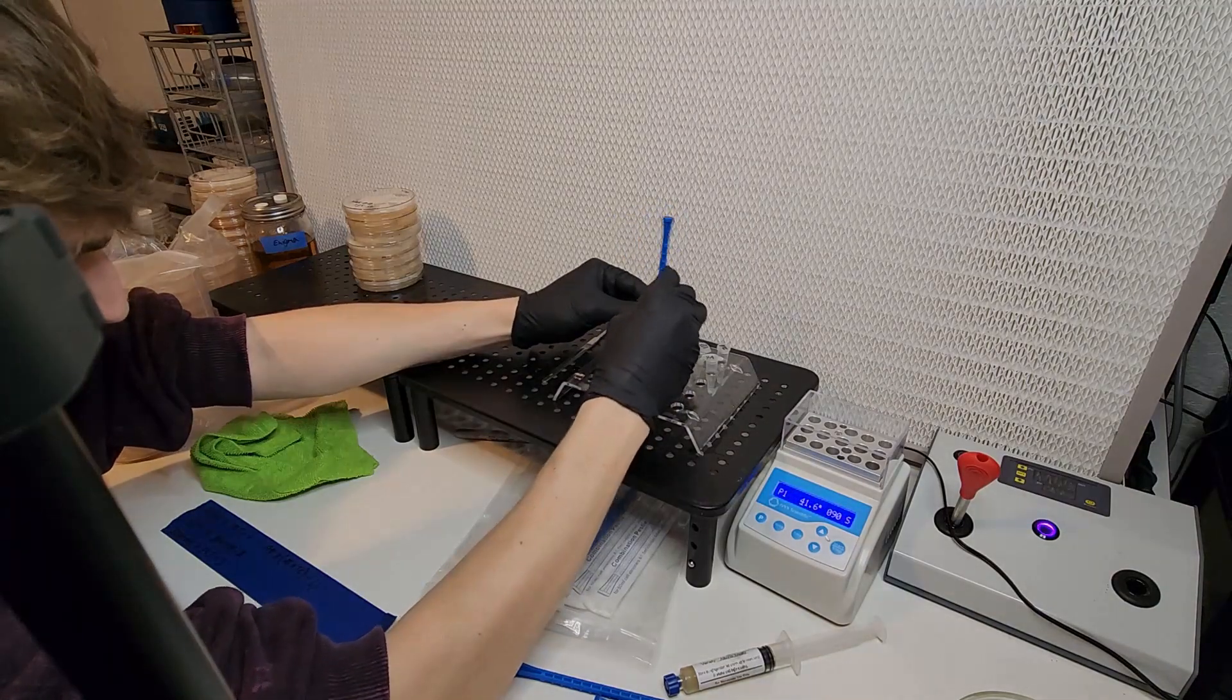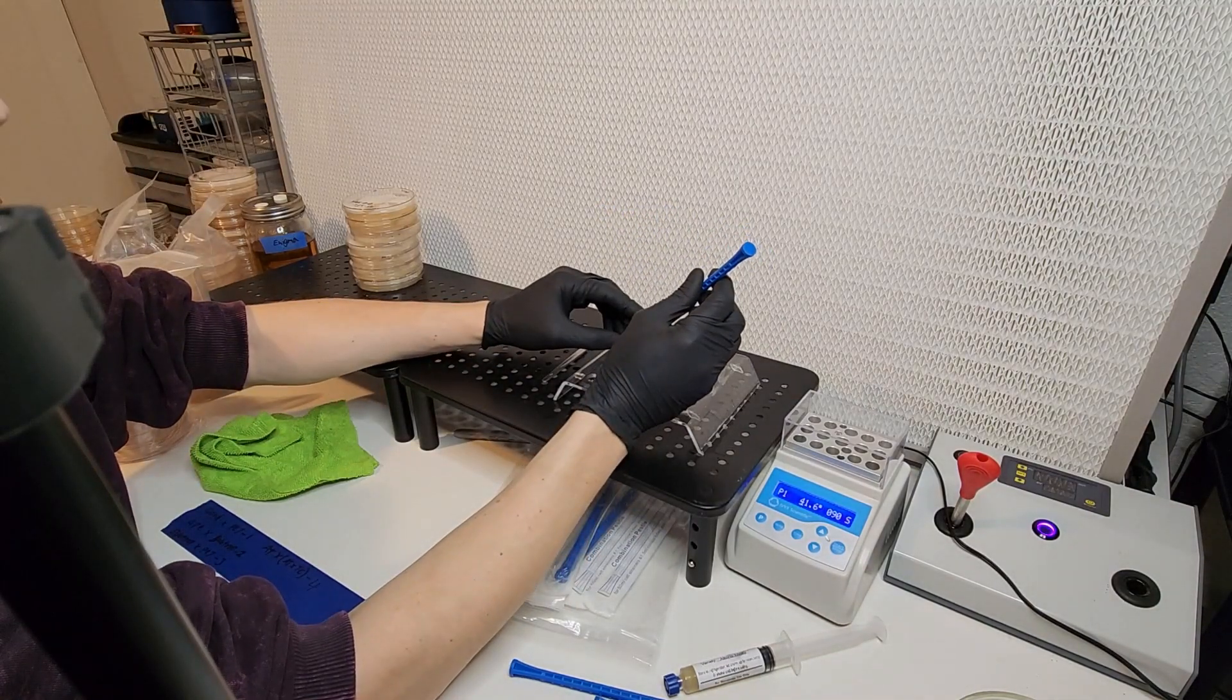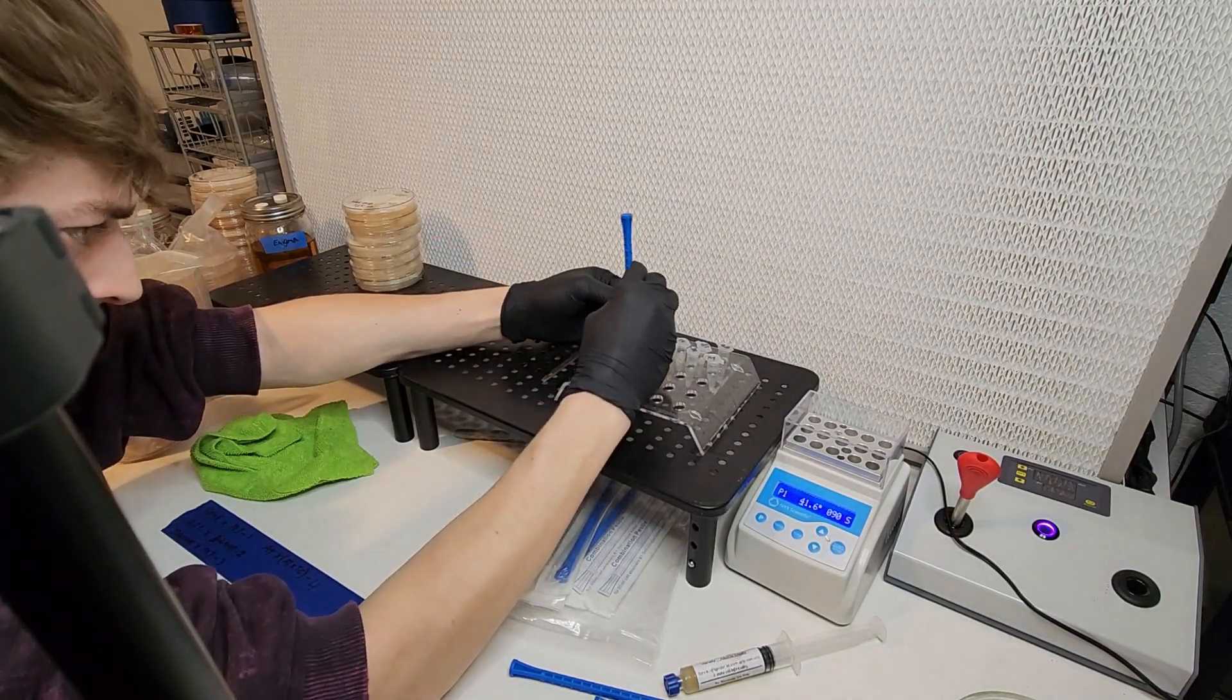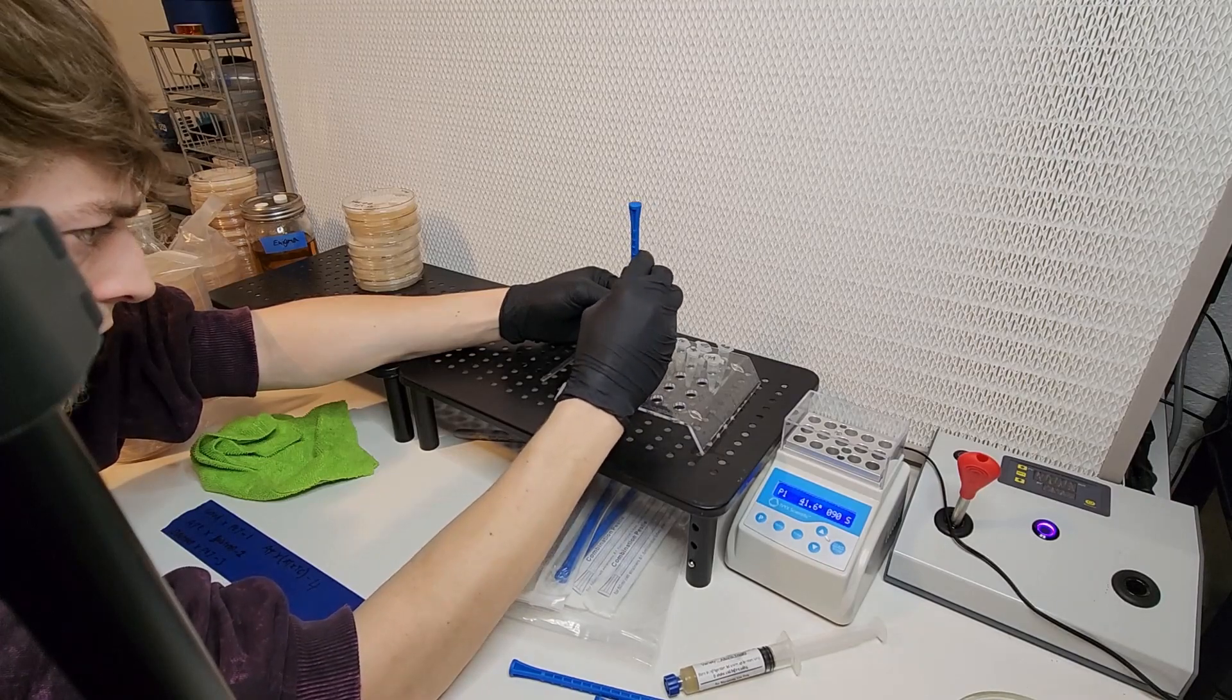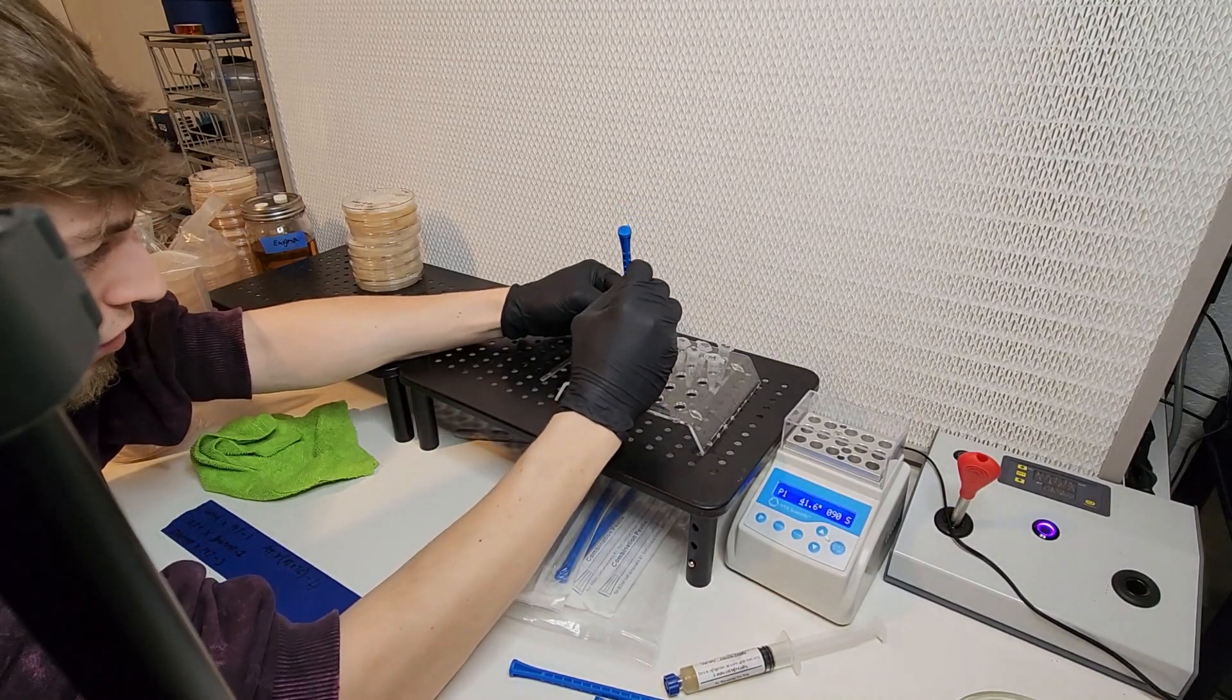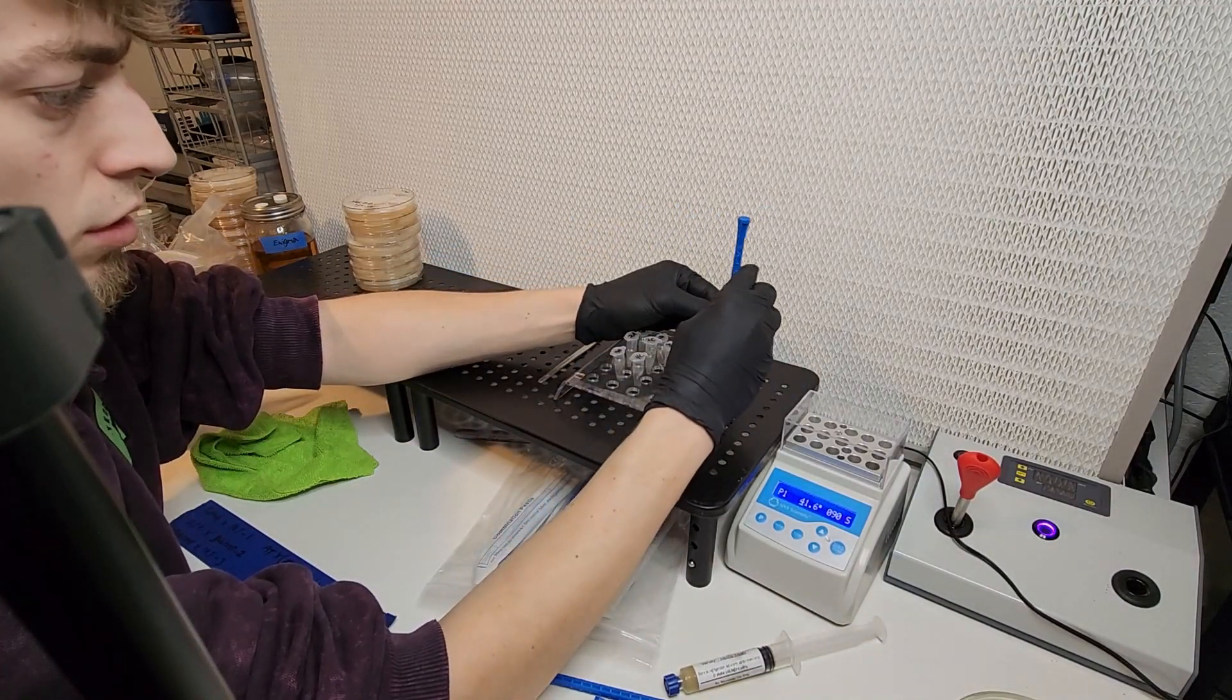Now as I'm mixing these tubes up, I'm ensuring that I do not cross-contaminate each one with a pestle that's been with a different set of strains. So you can use the pestle for more than one tube so long as it's the same cross attempt, but if it contains different strains then do not use it.